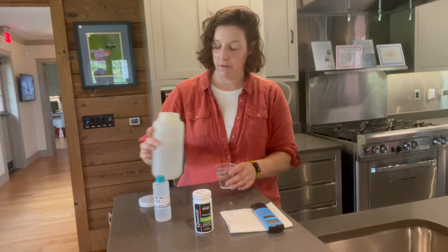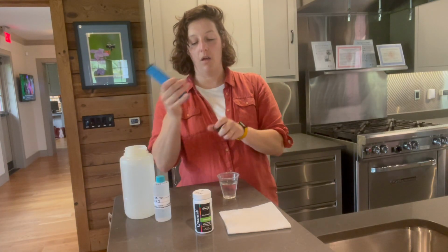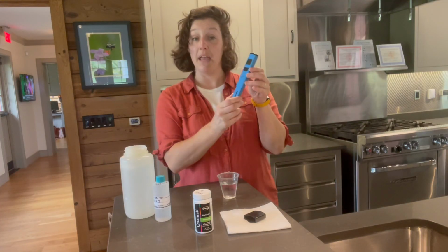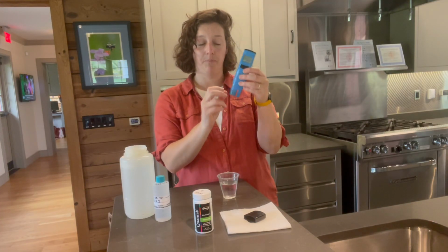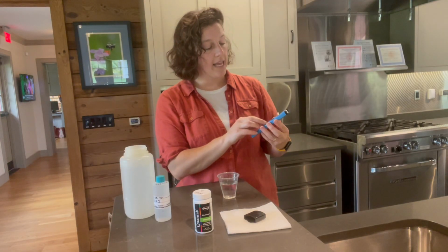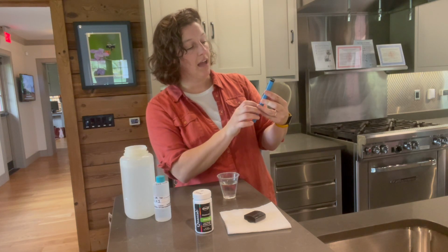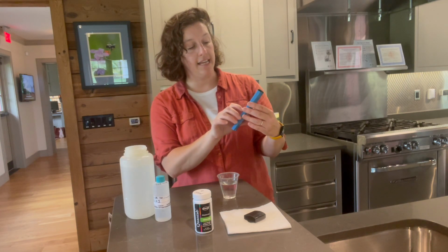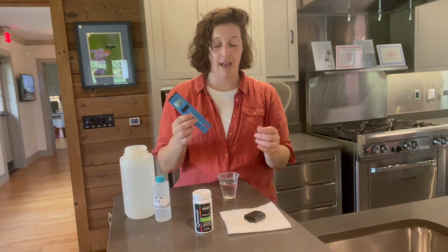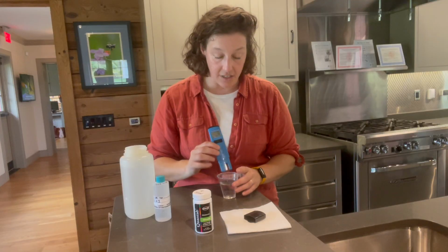So once we've triple rinsed our cup, we'll fill it up with 1 to 2 inches of water. And the important thing is we want to make sure that the bottom of our sensor, where it's taking the reading, is fully submerged in the water. So I'll take my Hanna meter, press the power button, and then it turns on and tells me the air temperature. It's been sitting in the lab, and then we'll stick it into our water.